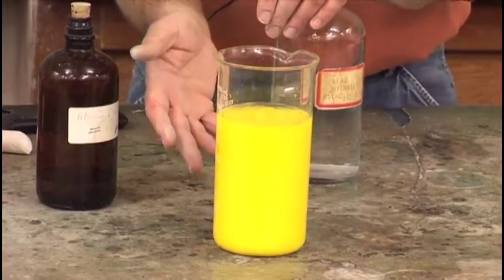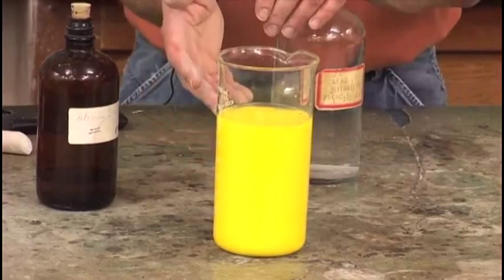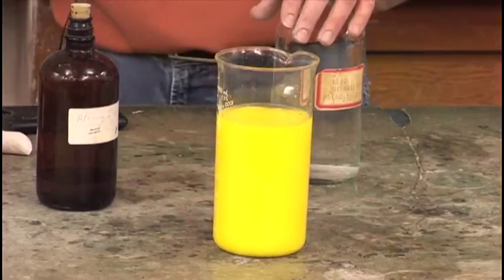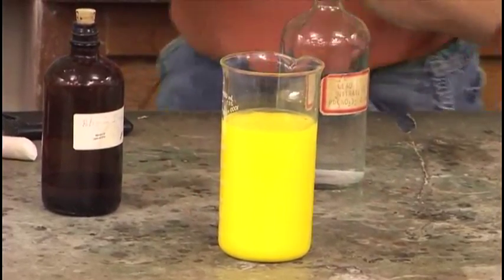Over time it'll crash down to the bottom of this beaker. It is lead iodide, which is very heavy, so it'll sink down to the bottom of the beaker. Let me show you the net ionic equation and the overall reaction.